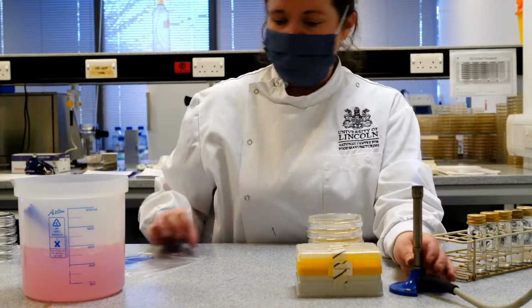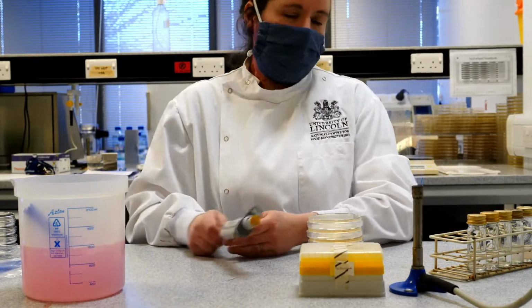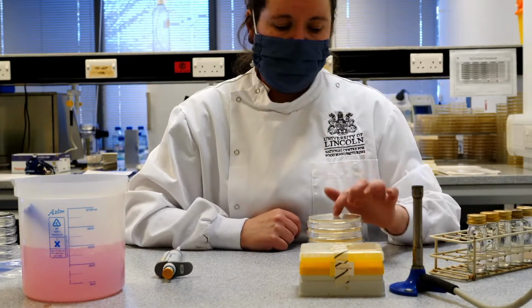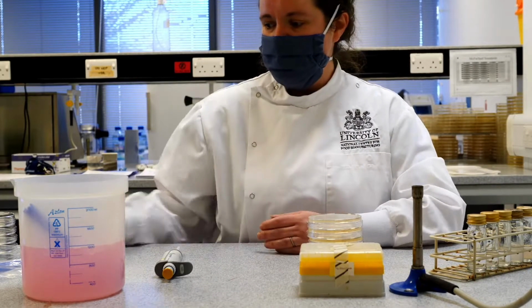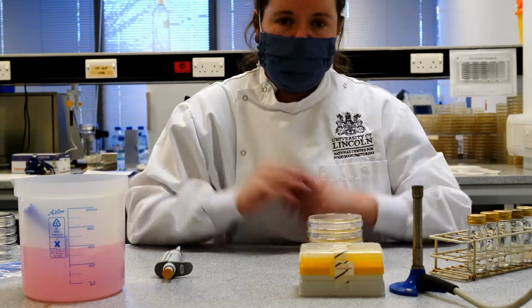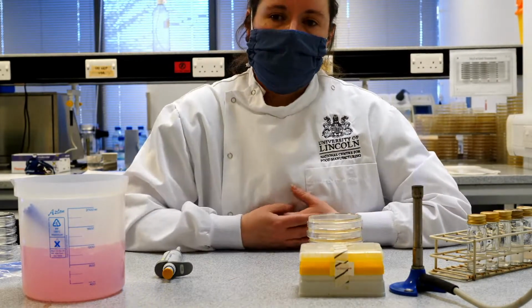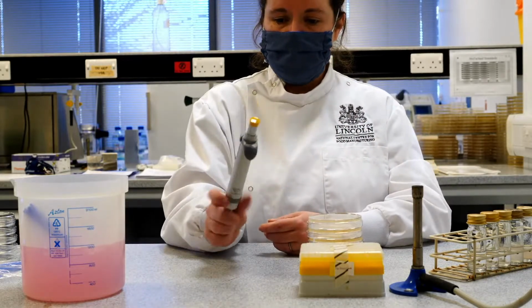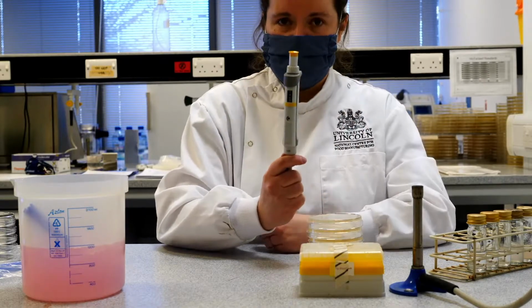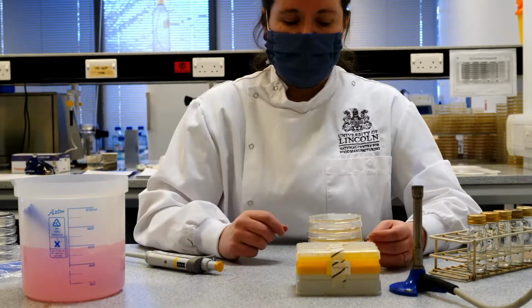So what we're going to be doing in this case, it was a bit noisy there, wasn't it? We're going to be pipetting 0.1 millilitres or 100 microlitres onto the surface of the agar plate, and then spreading that liquid around. So we spread the bacteria right the way across the surface of the agar, and then they'll go in the incubator, and we'll be able to look at the results of those tomorrow. So I'm going to take this time a 100 microlitre pipette, which is set to dispense 100 microlitres of liquid, and this time we're using the smaller tips, the yellow tips, for that to happen.